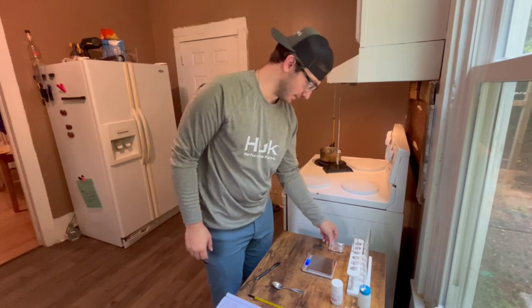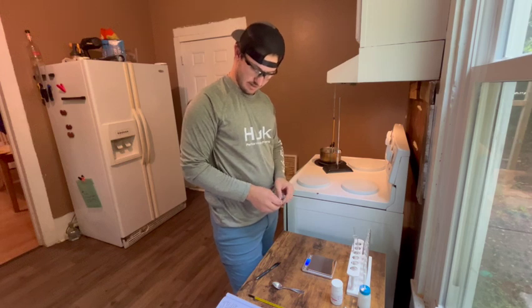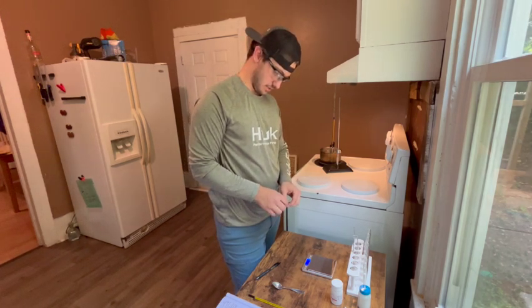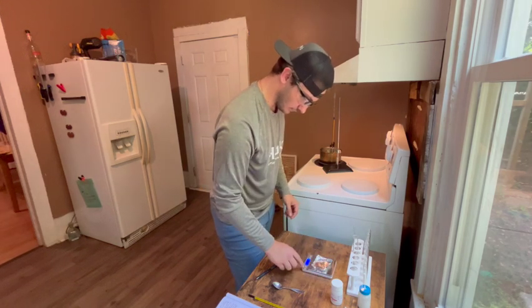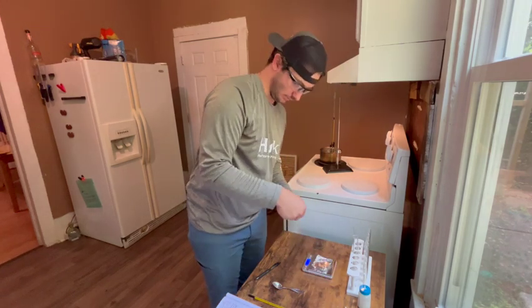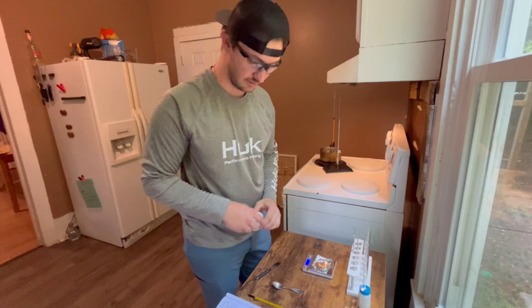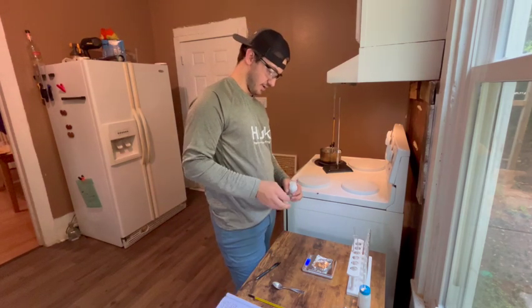While we're waiting though, I'm going to go ahead and measure out the naphthalene that I'm going to need for the third part of this lab. And for that, I'm going to need approximately 1.5 grams. So I'm going to measure out 1.5 grams of the naphthalene, the C10H8, just while we're waiting for the rest of that water to heat up.